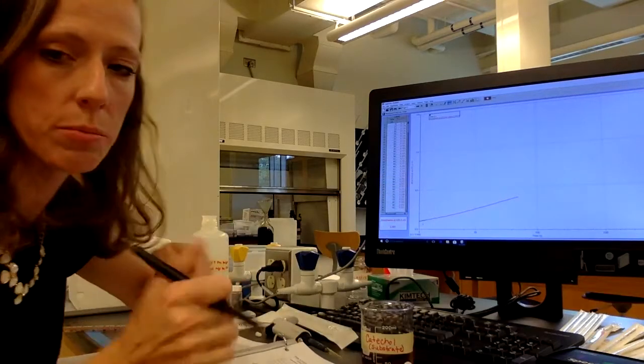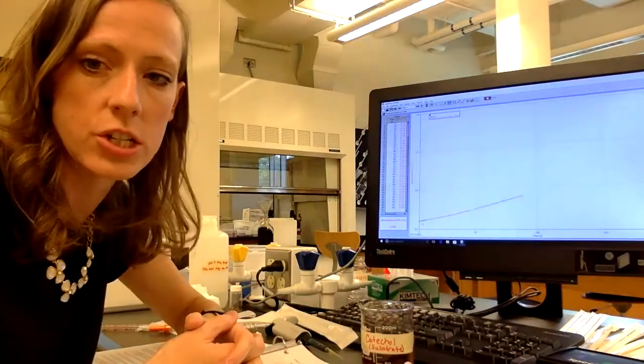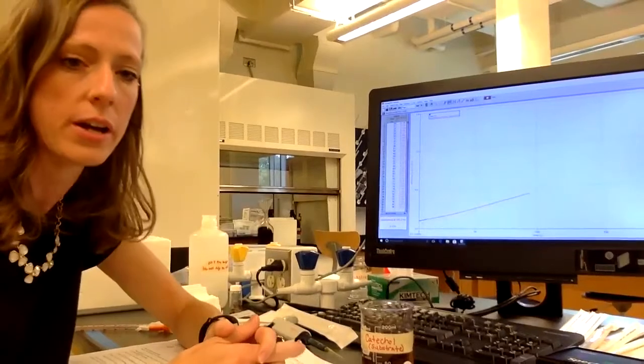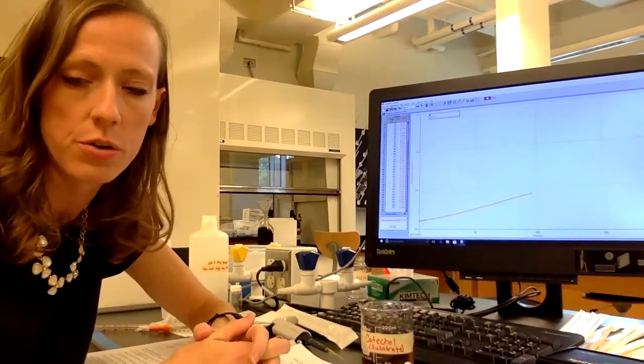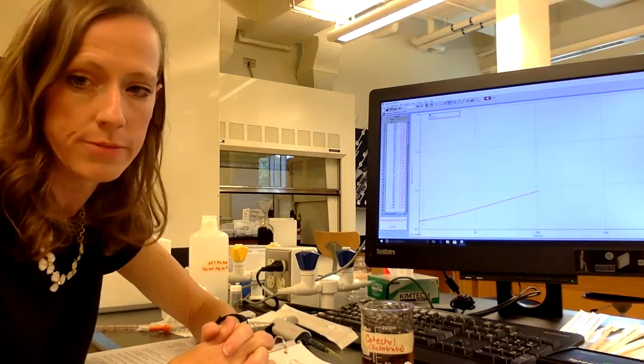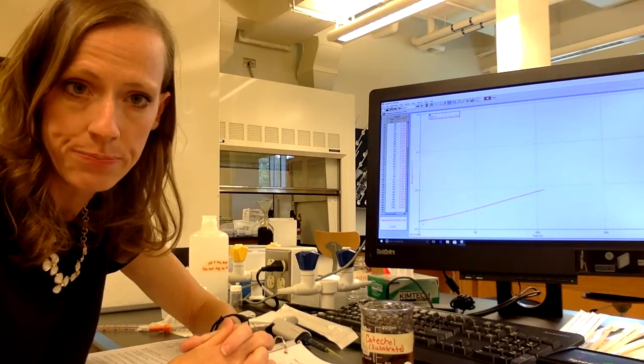And again, I would repeat that a second and a third time. We like to do everything in triplicate as long as we have enough time so that we get a good representation of the data. And if I did fumble a little bit and go a little bit slowly on the one, hopefully the second and the third would give a more accurate representation of the experiment, okay? So I think that's about it for today.